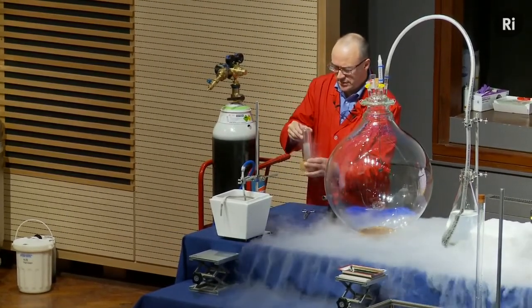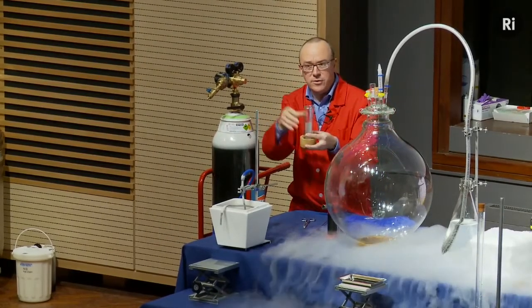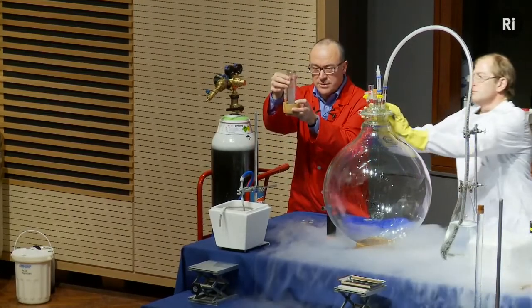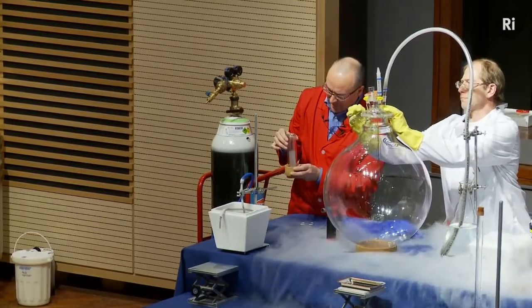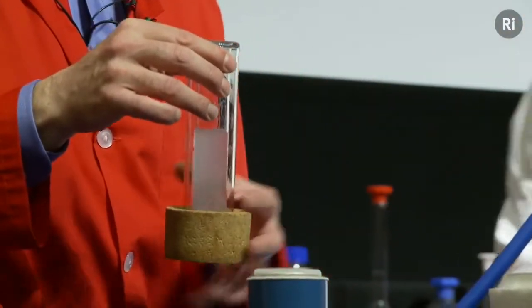And you may be able to see that although the air contains 1/5 oxygen, and the air of course is completely transparent, and yet oxygen, when it becomes a liquid, turns this lovely blue colour. Okay, so we're going to use this liquid oxygen then to fill this flask with oxygen.